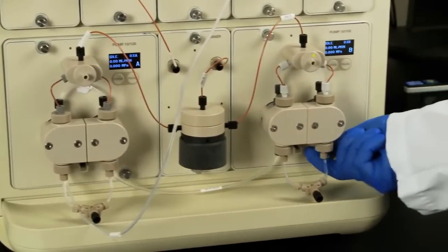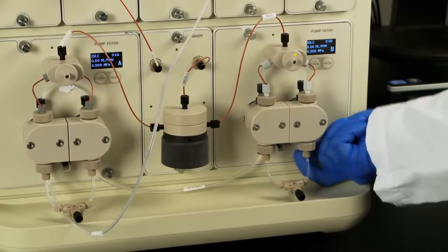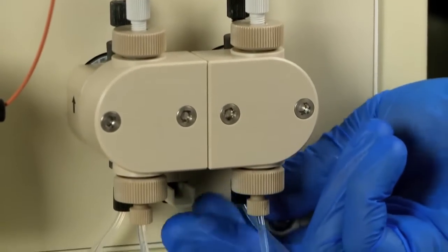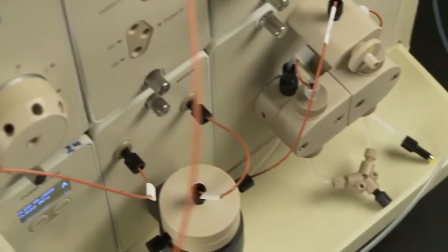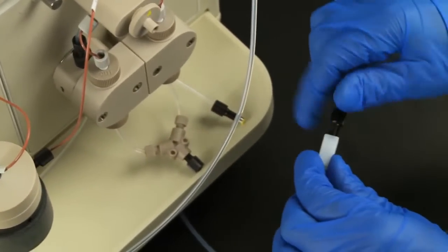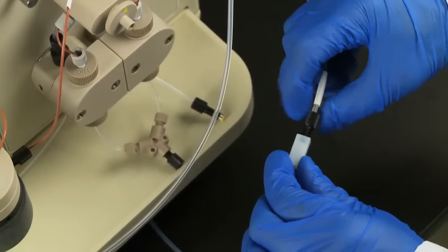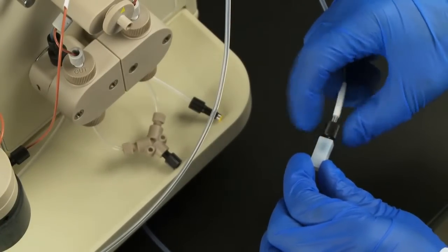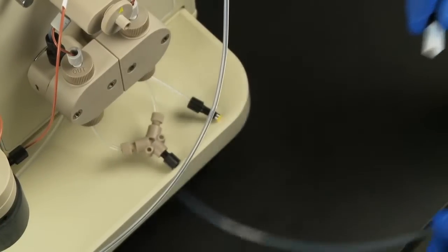Next, attach the pump wash priming line to the System Pump B wash outlet, right-most bottom port. Connect a quarter-twenty-eight union to the second inlet line. You will use this as the outlet line for the pump washing system. Set this line aside as you will attach it to the priming line after the washing system has been primed.